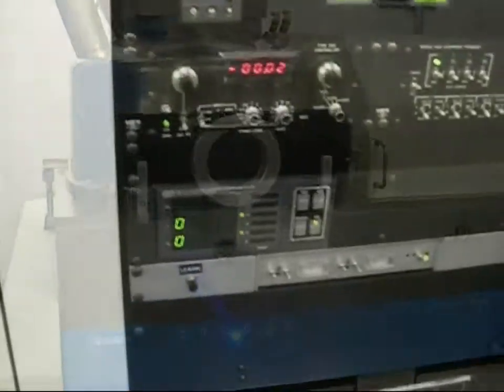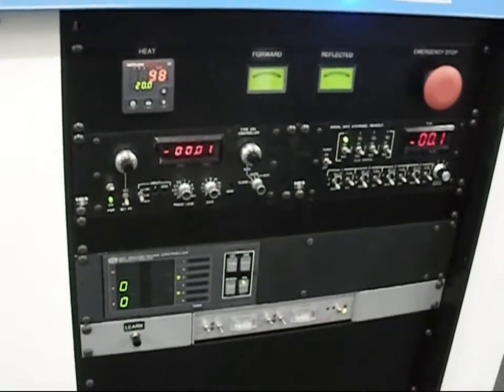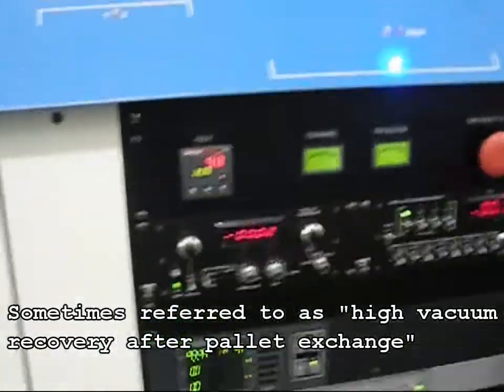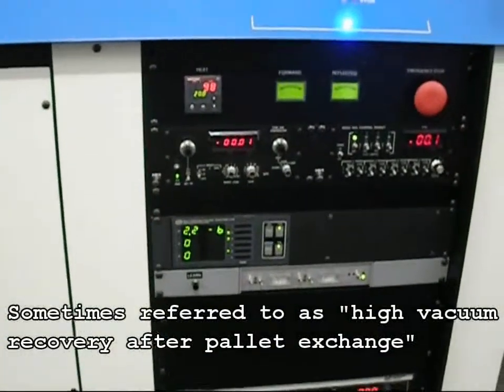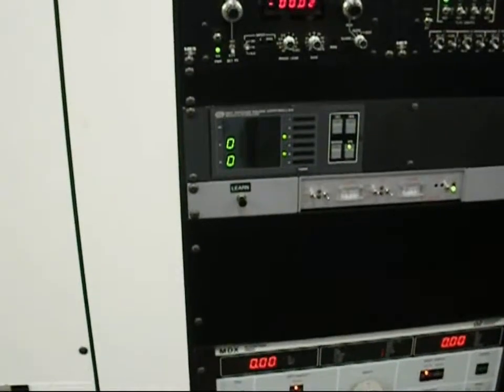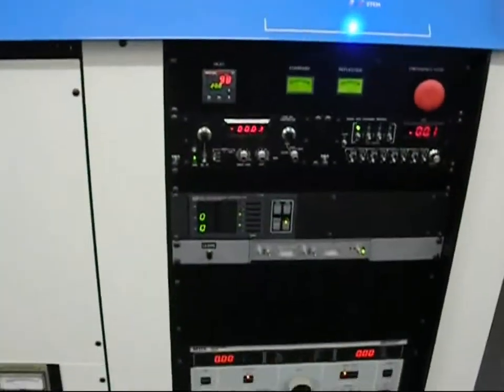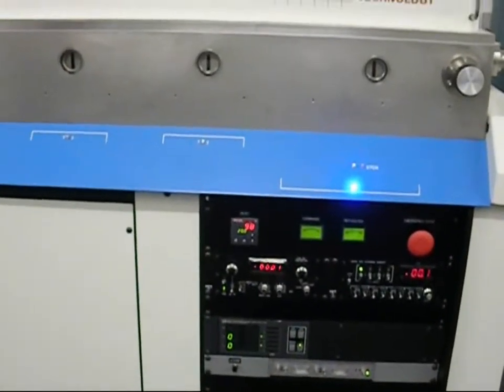The next step involves re-establishing a suitable high vacuum level in the main process chamber. At this time, the GP307 gauge controller will be automatically switched to monitor and control the main process chamber's high vacuum level, as it is being high vac pumped by the main chamber's CTI-8 cryo pump. Once the main chamber's high vacuum set point is met, the system is ready to start an automatic pre-programmed process recipe.